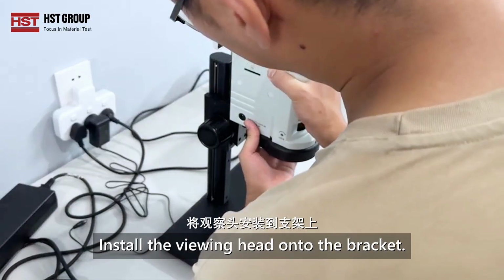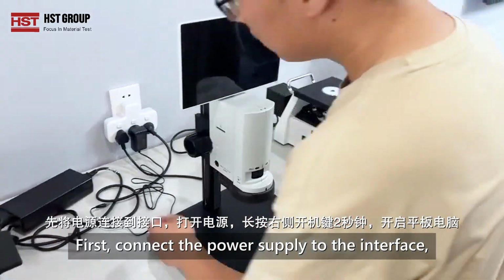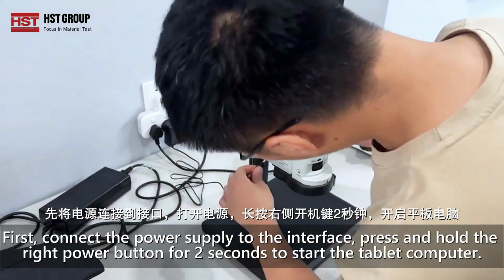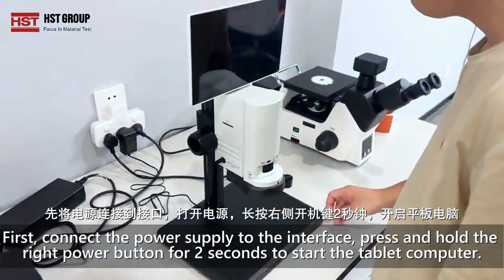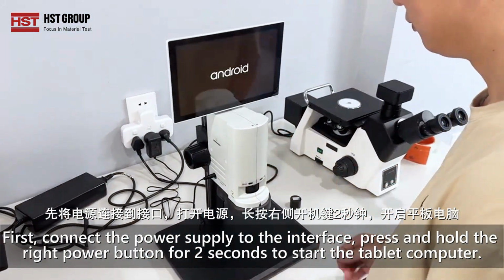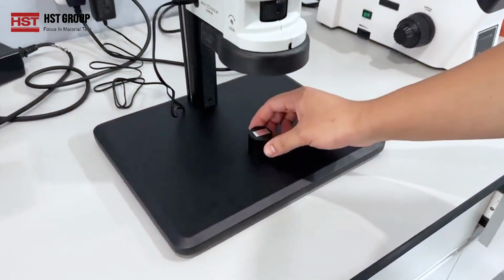Install the viewing head onto the bracket. First, connect the power supply to the interface. Turn on the power and press and hold the right power button for 2 seconds to start the tablet computer. Place the sample to be tested on the platform.